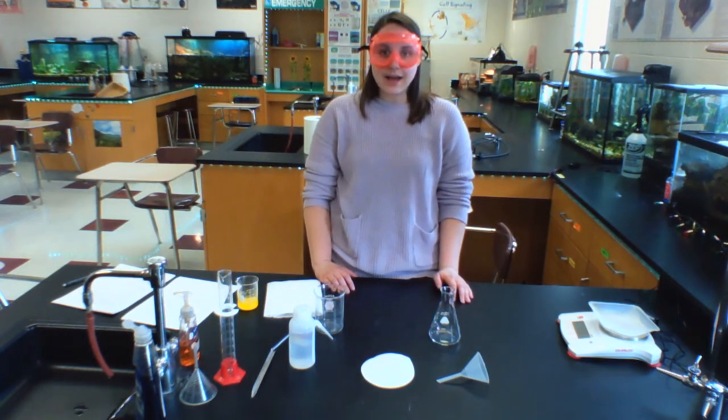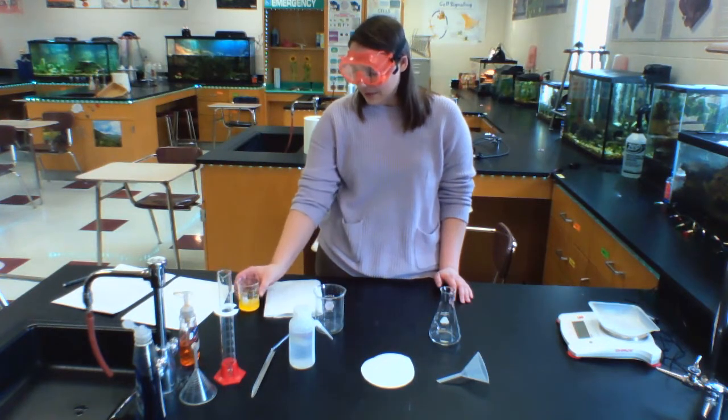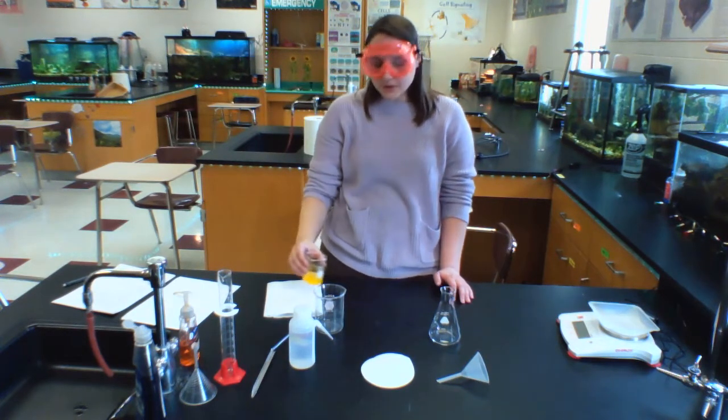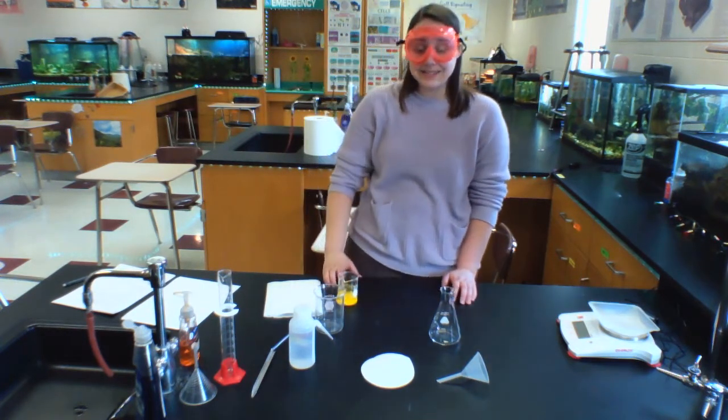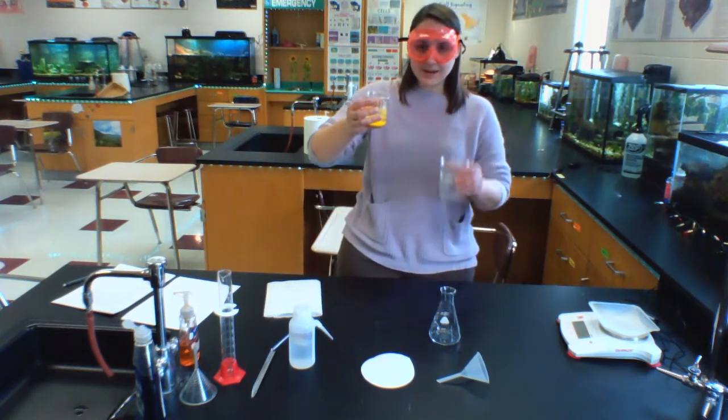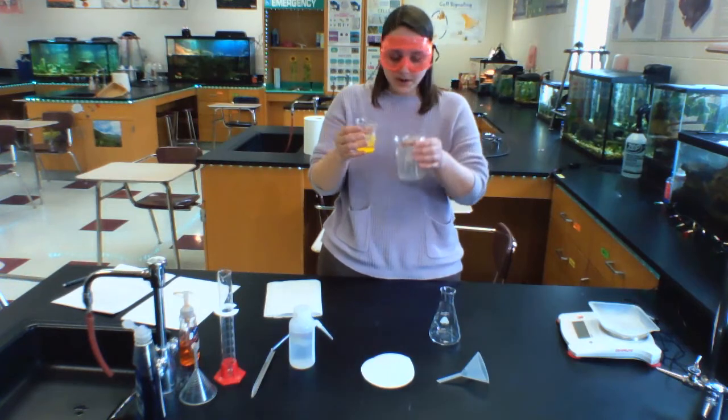So here's the thing. I don't want to have to deal with all of this water. The precipitate separated down to the bottom of this beaker. And so I'm going to first do a step called decanting. And I'm going to decant the water off of the surface here and into this beaker for waste products.